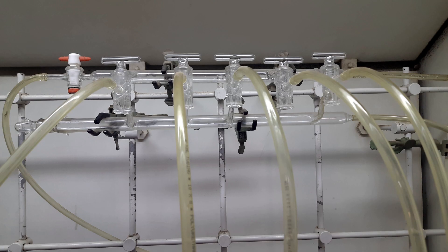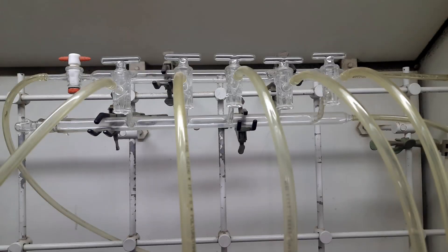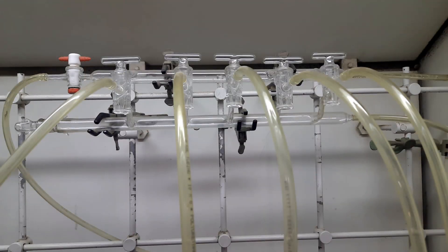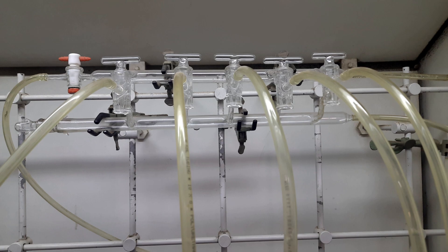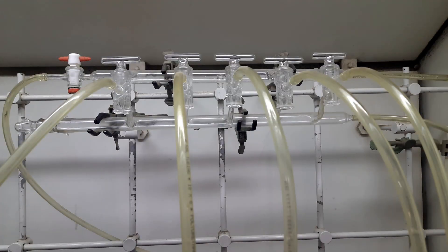This is a Schlenk line, discovered by German chemist Wilhelm Schlenk. This enables us to perform a reaction in a moisture-free environment. The two channels allow us to switch between vacuum and inert environment, and the tubes are connected to the reaction chamber.